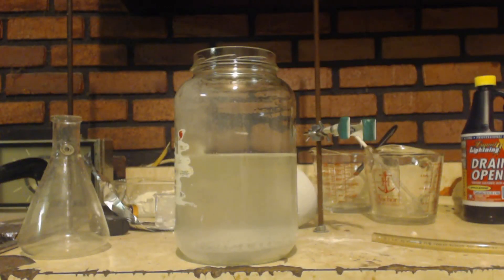This is part three of sodium ethyl sulfate synthesis. Now keep in mind, I'm taking this to a pH of seven. The way you're supposed to do it really is to probably take the pH up to 10. When I look at pH papers, anything 9, 10, 11, 12, all the way up to 14, they all look the same color to me — they're all purple. I can't distinguish the difference between any of those pHs with pH paper. So that's why I take it to a seven, then make it really basic, because I can't distinguish the difference. My belief is that you should take this to a pH of 10 or 9 first.